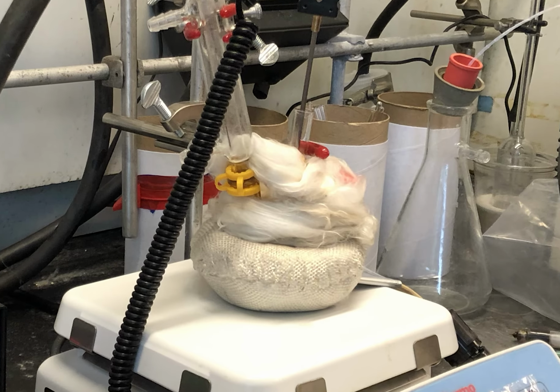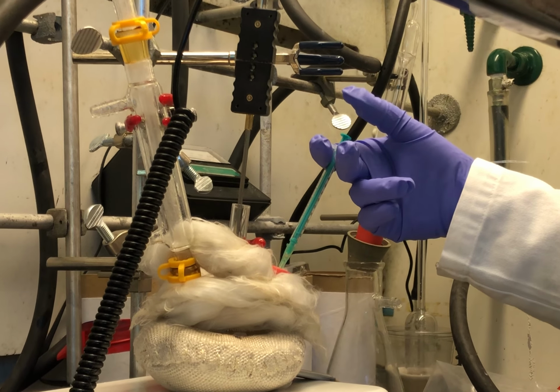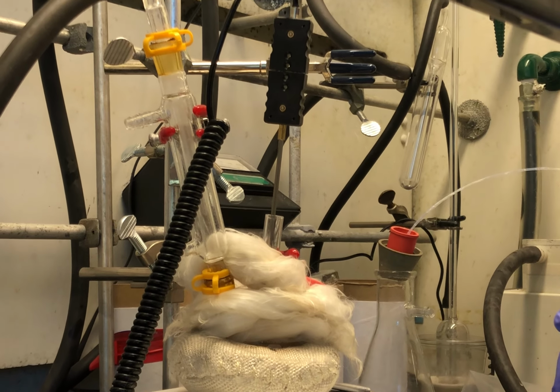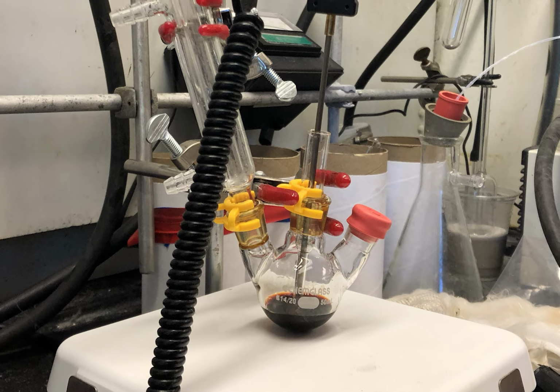After heating it up to a high temperature, we injected the precursor for the anion. This is called a hot injection synthesis, and it is how many quantum dots are made. The solution changed from yellowish to a deep red, signifying that the synthesis had finished.